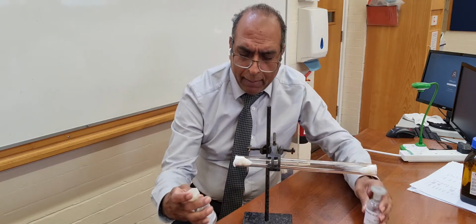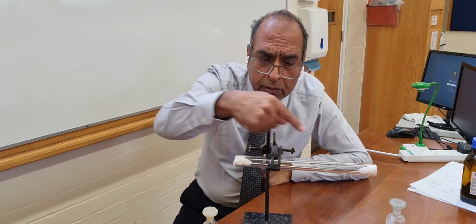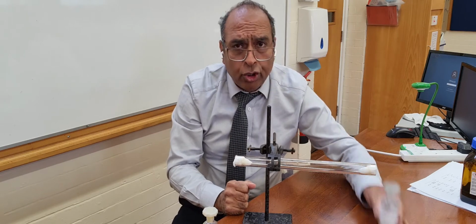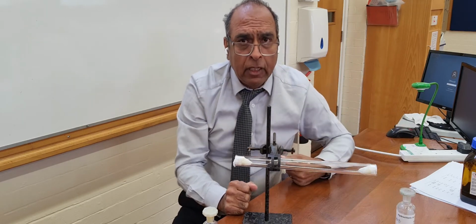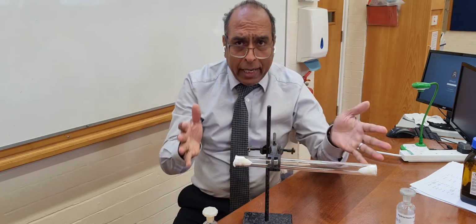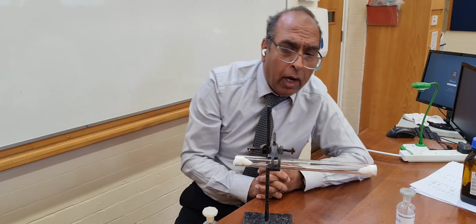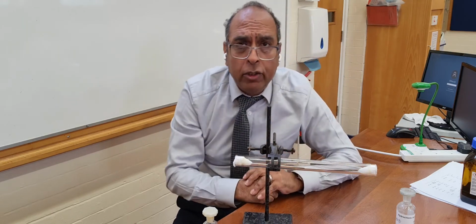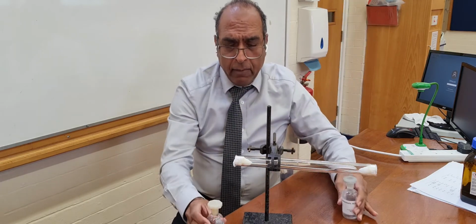And what's going to happen now is the ammonia will diffuse that way. The hydrogen chloride gas will diffuse that way. And where the two gases meet, there will be like a white mist of ammonium chloride. Ammonia gas and hydrogen chloride gas react to make ammonium chloride.